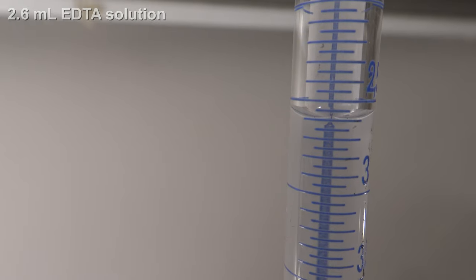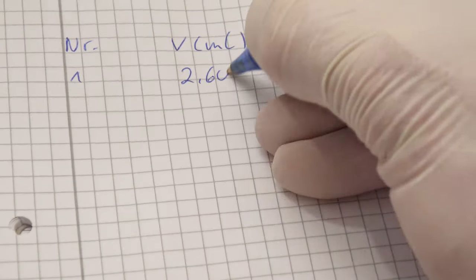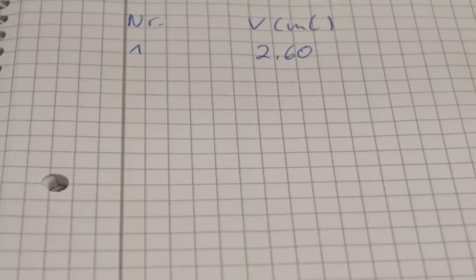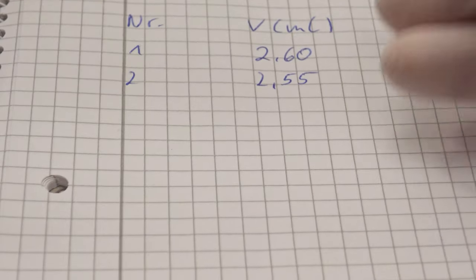In the first run, 2.6 ml of solution were added. In total, 6 samples were measured and at the end, the mean value was calculated.